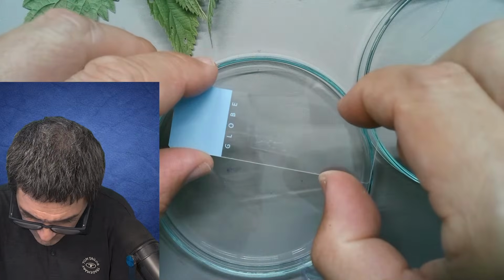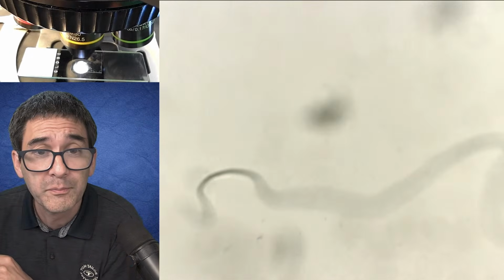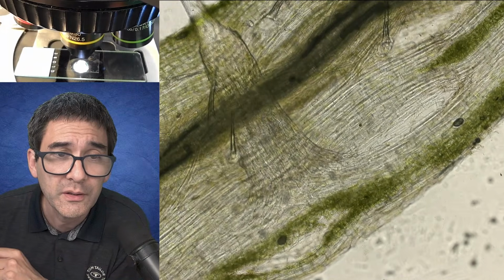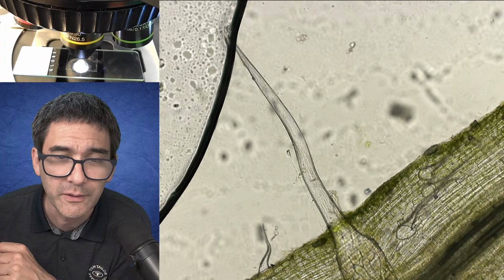Kind of compressing the specimen and hoping that I'm able to see something here. That is really a question of luck now. Let's see if we're able to find it. Compression specimens are nothing uncommon. And we were lucky. Gee, am I relieved? Here it is.